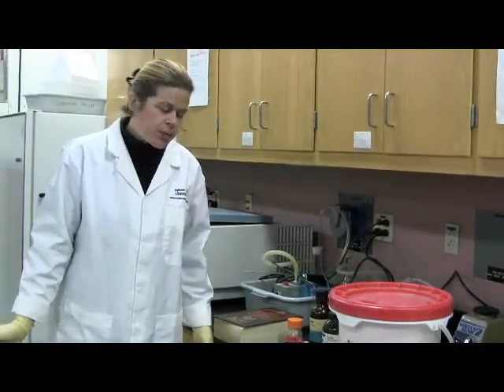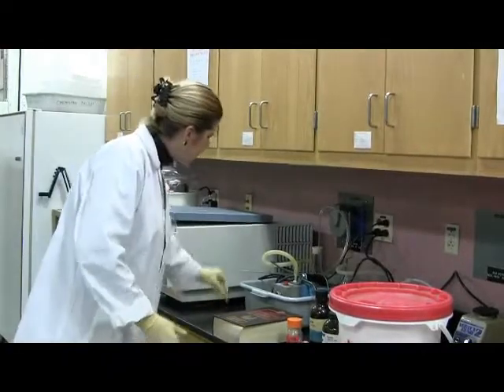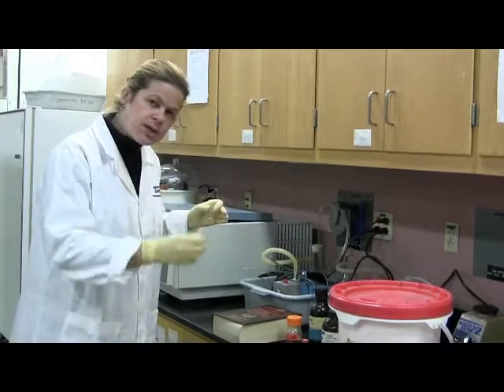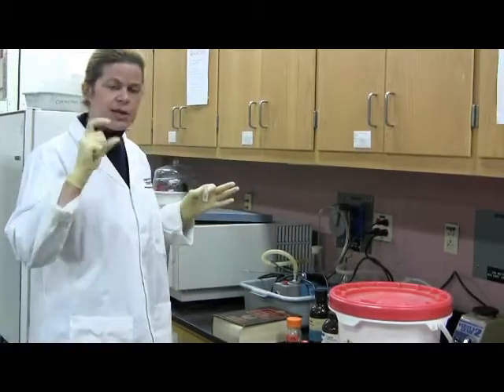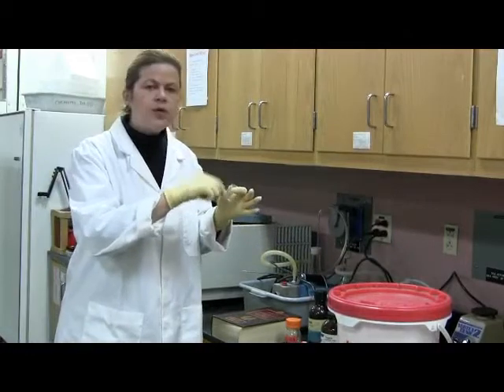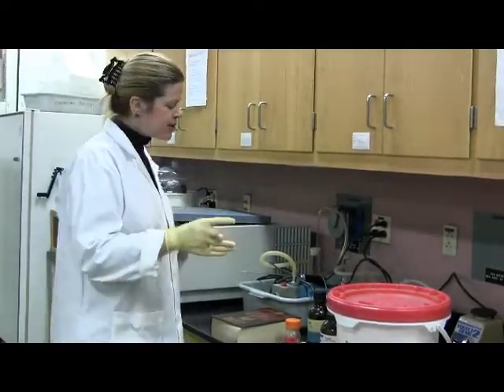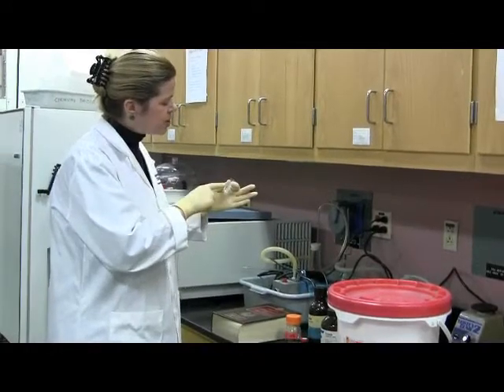A different presentation shows you how to use the spectrophotometer, but you're going to prepare your cuvettes, and you don't put in the enzyme until you're absolutely ready to stick it in the spectrophotometer. So that enzyme is the last one to go in, because remember, you want to measure initial rate. You want to measure the initial rate of the enzyme. So if you leave the enzyme in there for a while, then some of the substrate has degraded and the concentration of the substrate has gone down, and you are no longer measuring initial rate. So this is an important point. The last solution you're going to put in there is the trypsin.